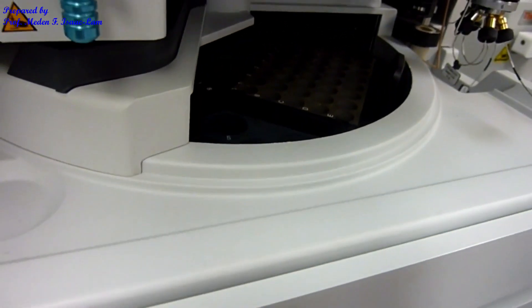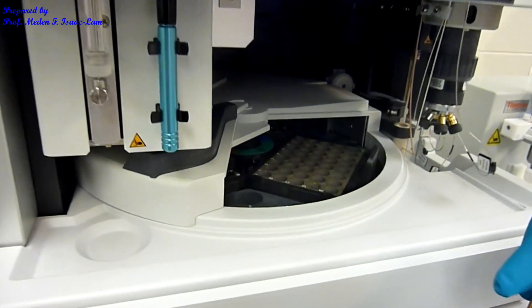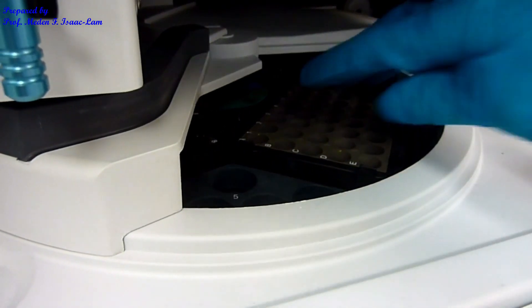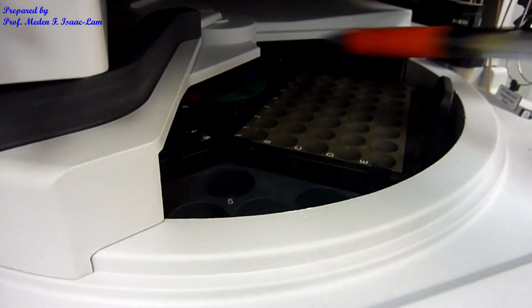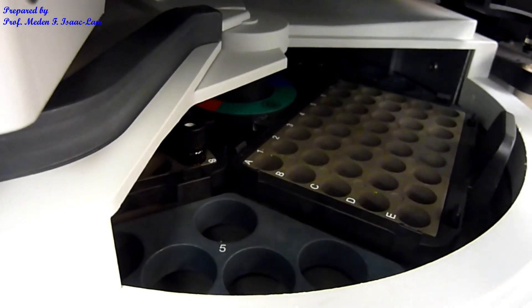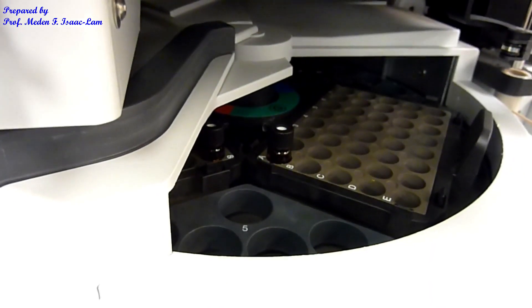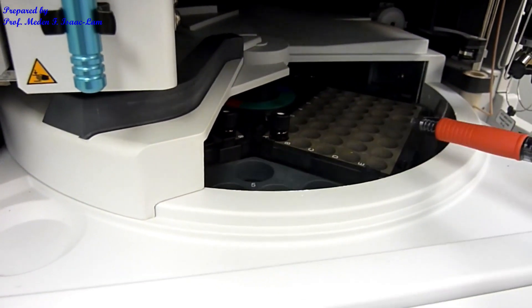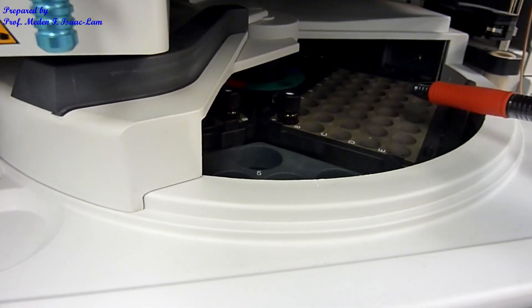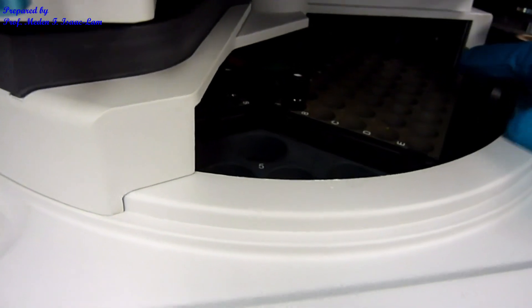This is now our HPLC instrument, and our sample — we're going to put it in the plate. There's an 8x5 plate with 40 slots, and it's color-coded as green. It's labeled A1 through A8, and rows A through E. I'm going to put it in the first slot, green A1. This can accommodate 120 vials total, because each plate is 40 slots, and there are three plates labeled blue, red, and green — so you can just rotate it.